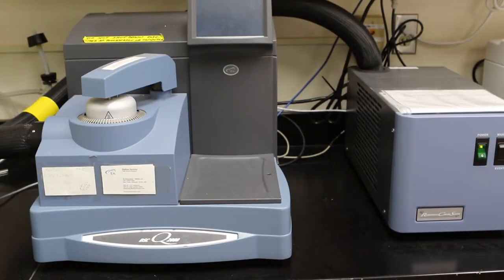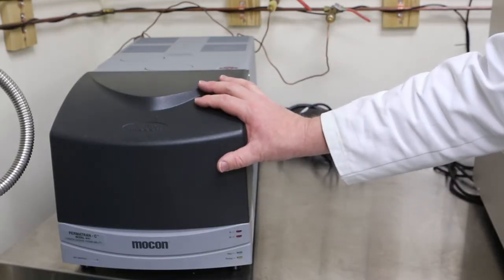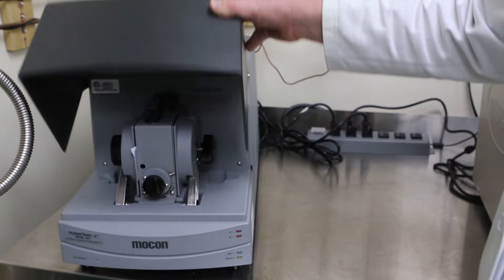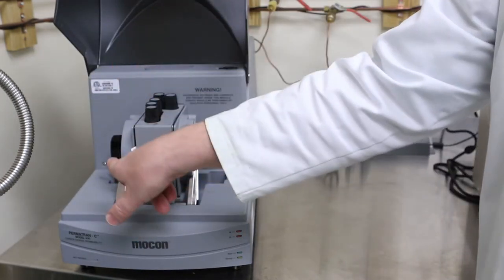We train them on what's called a Fourier transform infrared spectrometer, or FTIR for short. That instrument looks at the chemical bonding within a material and tells us about structure and how materials bond with each other, or compositional attributes of the material. We also train them on a differential scanning calorimeter, which is another instrument for measuring thermal changes in a material as either it melts or as it recrystallizes, and how that process occurs.